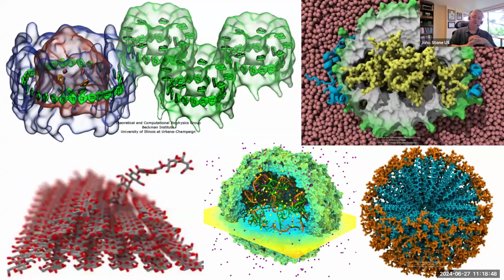One of the other benefits of ray tracing methods is they can simulate various optical effects like transparency much better. So if you're doing surface renderings, for example, in the top left, we have light harvesting structures where you can see little chlorophyll rings, the little green circular structures there, and carotenoids are shown in orange. And we've got the surfaces there for context. So the surface is there just to show you the overall structure and the placement of those chlorophyll rings within that structure. This is a very common need when you make your own molecular visualizations.